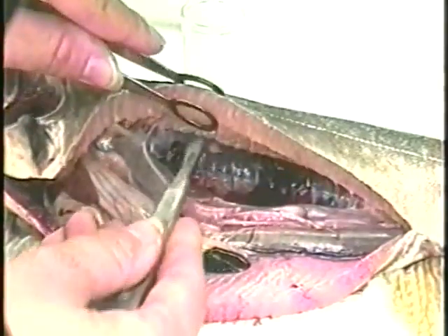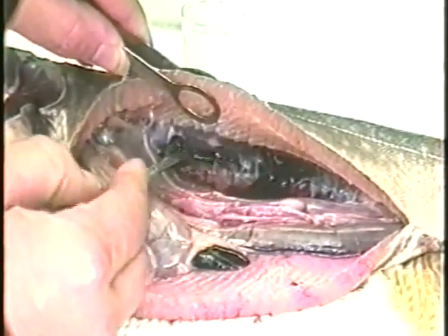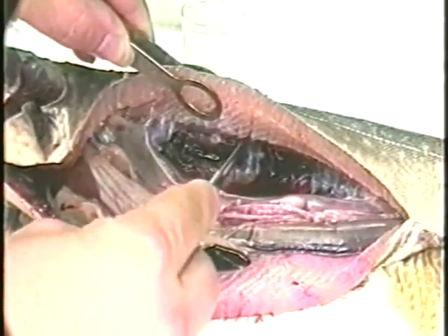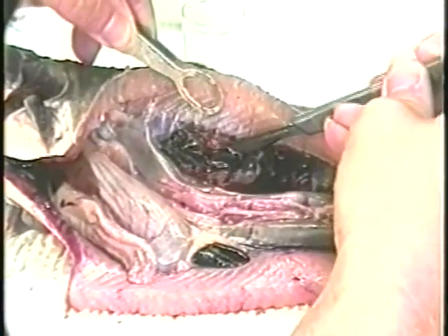The tissues normally taken are the kidney, spleen, and the gill filaments. Using a scalpel, cut out a portion of the mid-kidney about 1/2 centimeter squared. This is done by cutting along both edges of the kidney, then making perpendicular cuts.